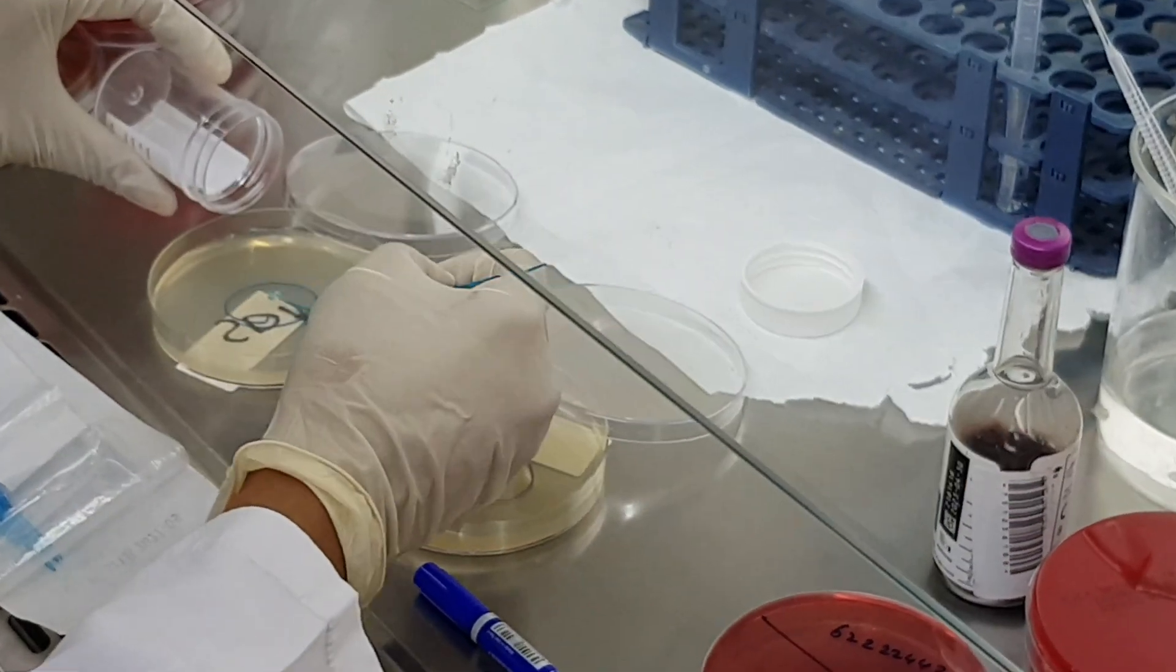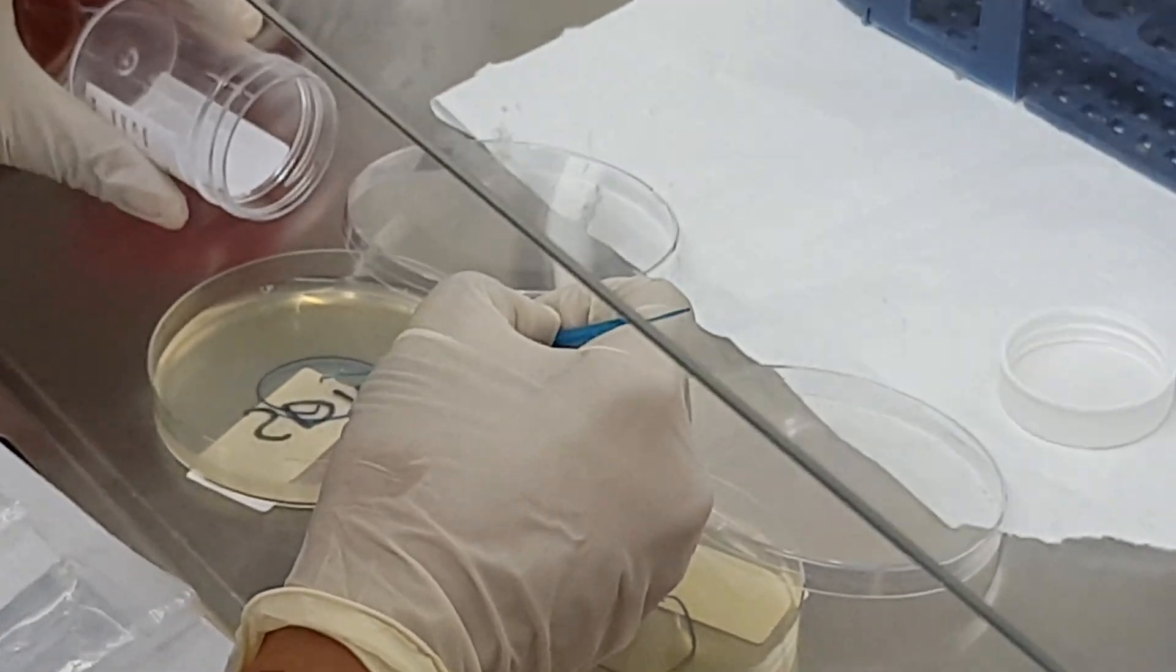Sabouraud dextrose agar is commonly used in the lab to culture fungi in different samples including nails, hair, or skin.